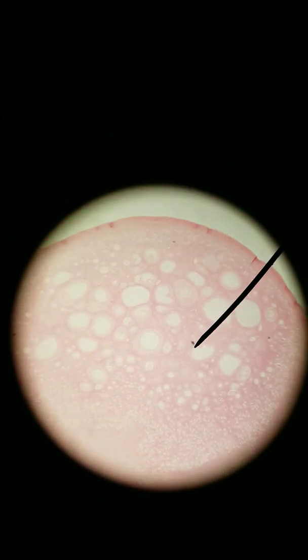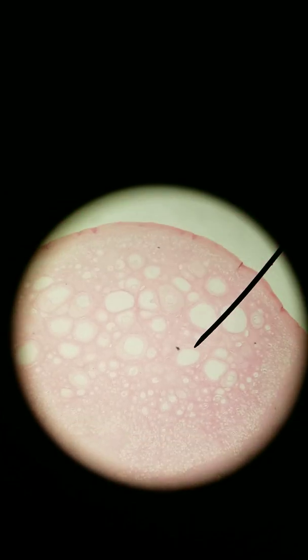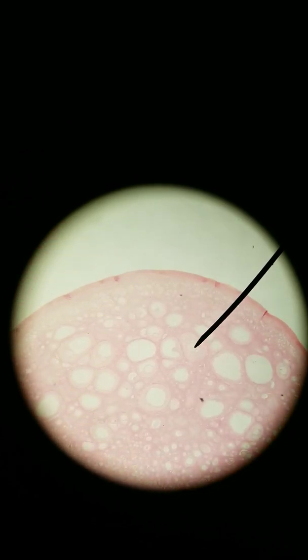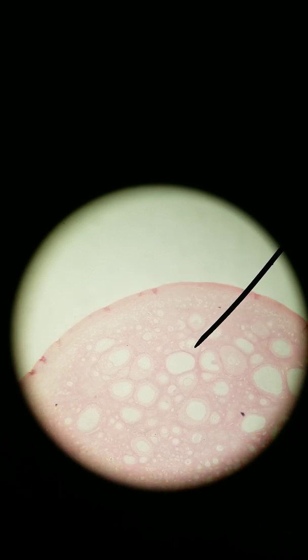In the ovaries, here we have a slide of the ovaries. We know we're looking at the ovaries because we see a bunch of round things, but they're all different shapes and sizes. Those are also called follicles, like what we saw in the thyroid. But if you look real closely, sometimes they've got these interesting circular things at the center, or maybe slightly off to the side, like here or here. Those are the eggs. Let me go to 100x.